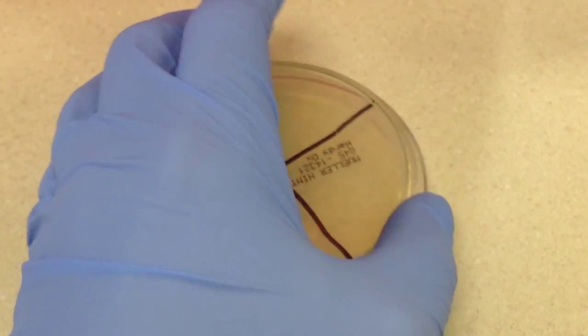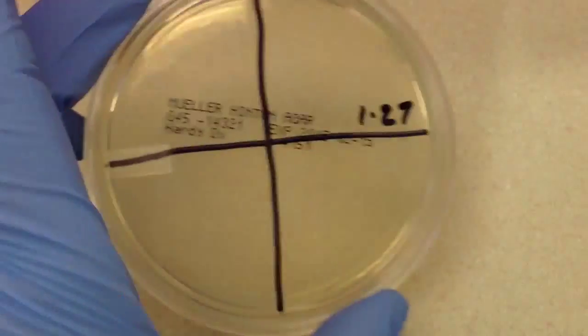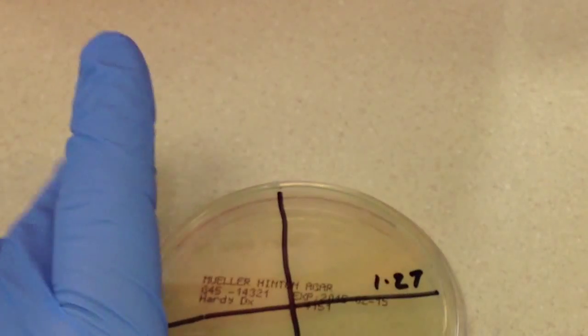Okay, that swab can be thrown away in the biohazard trash, of course. Alright, now it's time to go ahead and add our discs.